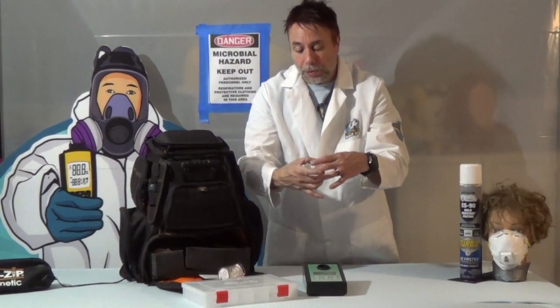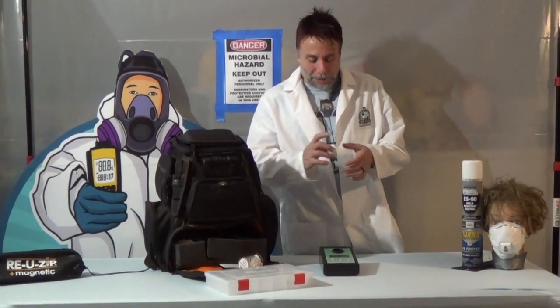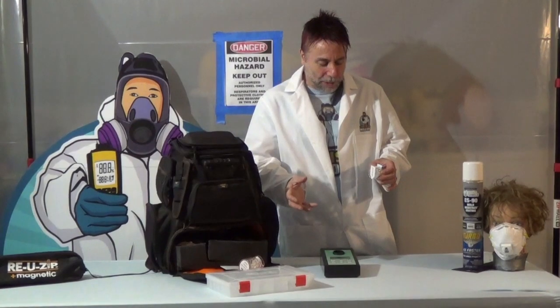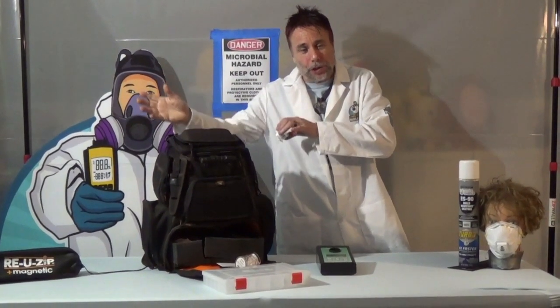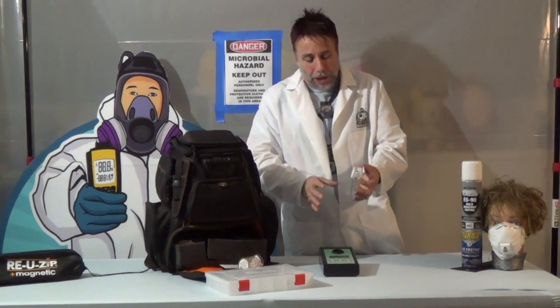What we'll do is take this, send it out to a lab, and they'll tell us exactly what's in it. It typically takes about 24 to 48 hours to get the results back. Not only will we see the results from your indoor air samples, but the mold inspector or mold assessor is also going to do a comparison test and test outside as well, so we're going to see that on the report.